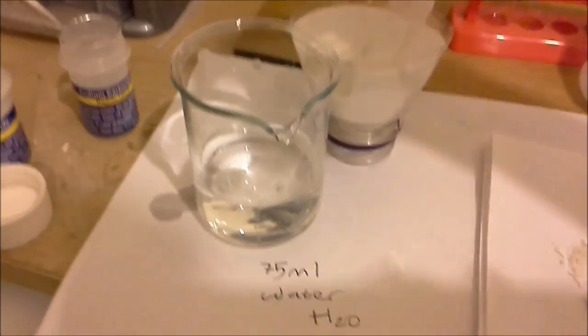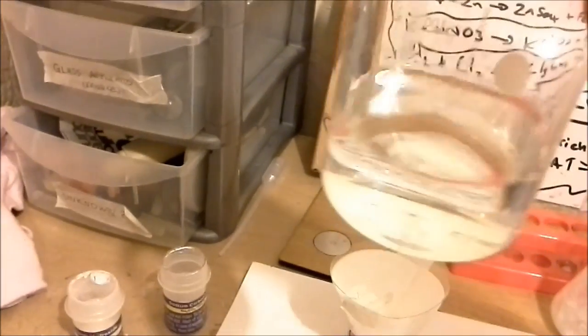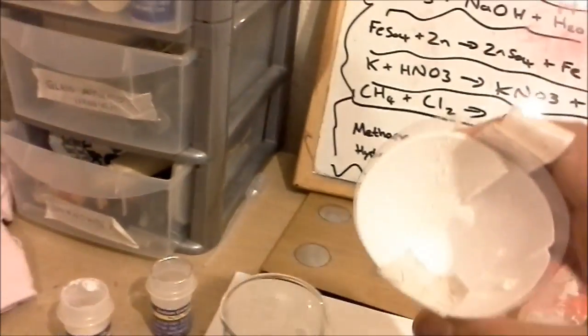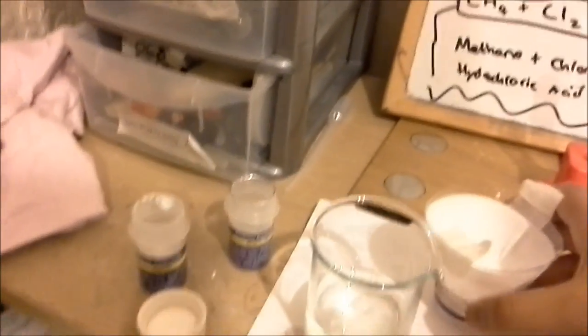So as you can see the sodium hydroxide is pretty much finished. And then here we have the leftover calcium carbonate which if you leave to dry out it becomes this.